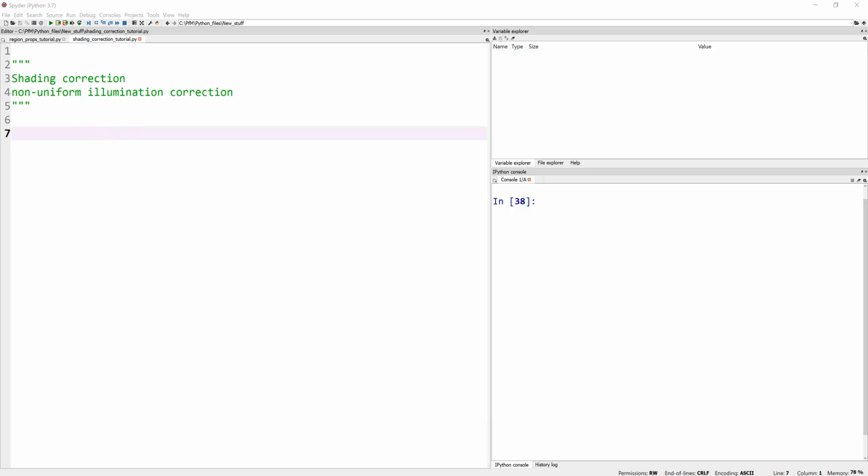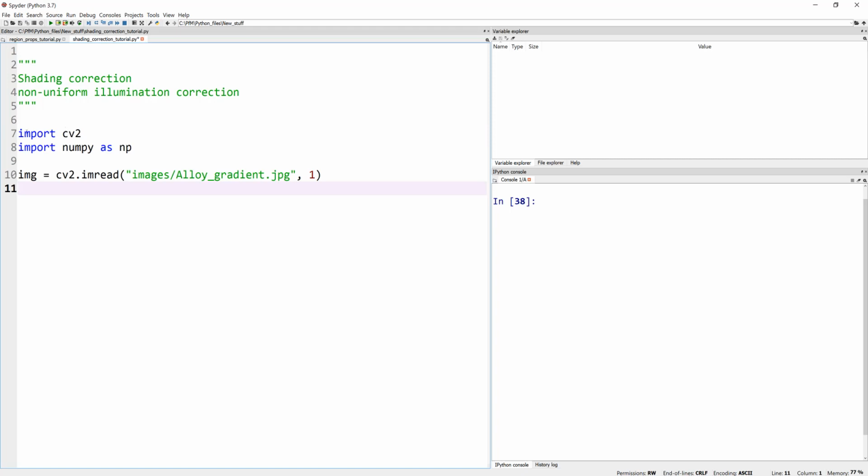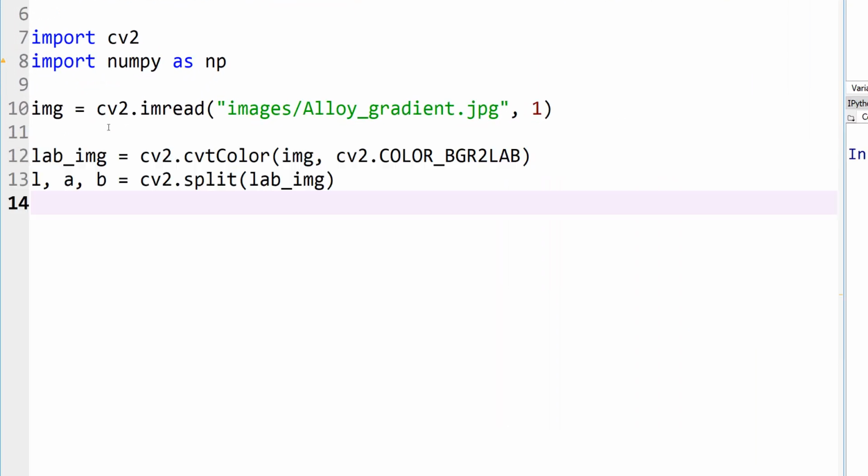So first of all, let me copy a few lines of code for CLAHE. And again, I already covered this in one of my previous tutorials. I'm not gonna dwell too much time on this topic, but I'm doing this so we can compare the result from here with the other, with rolling ball. So I'm gonna use OpenCV to read my image, and I'm reading it as a color image, and there is a reason for that, because for CLAHE, you can also read it as a grayscale image if you want, but I'm sticking with my previous tutorial. So I'm going to convert my RGB color into LAB space and only use the luminance channel, because A and B contain the color information, L contains the gray level or luminance information, okay?